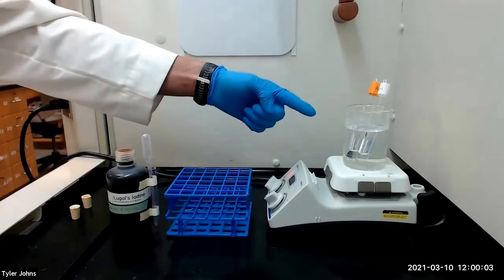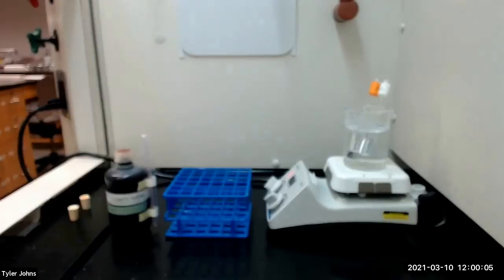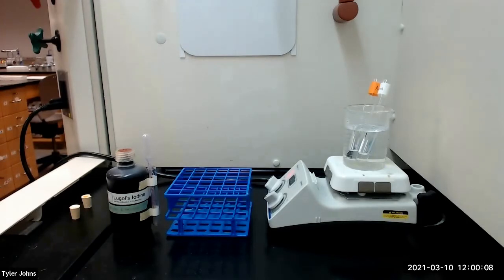We will then heat the mixture in the hot water bath for 5 minutes with occasional shaking. It is likely that the dark color of the iodine reagent will be discharged.